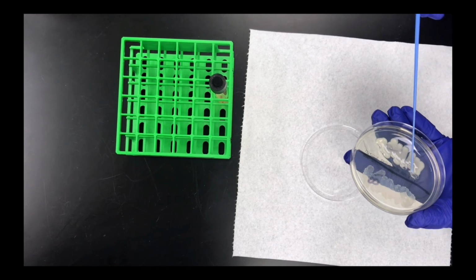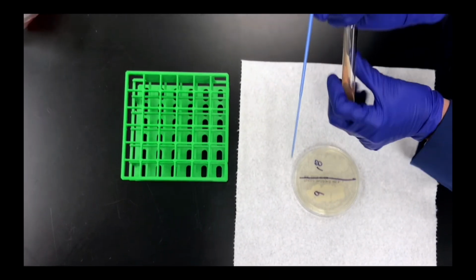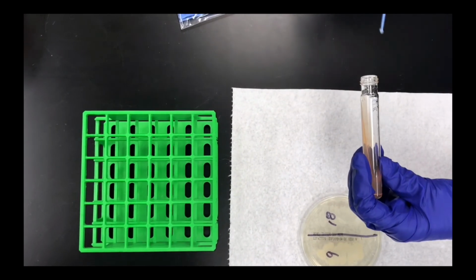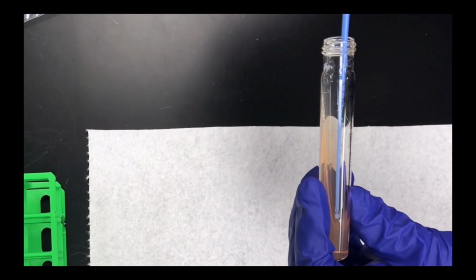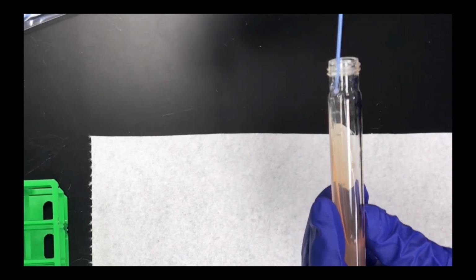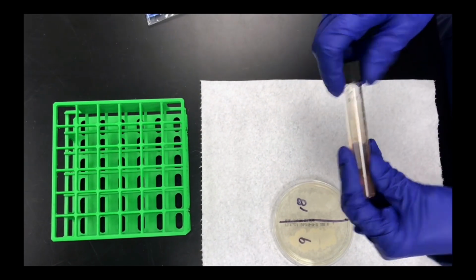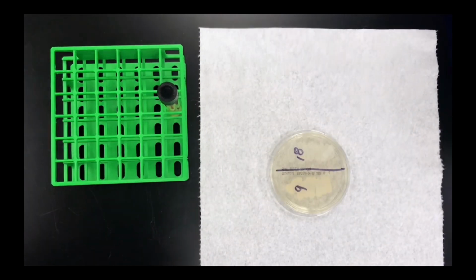So live, this is what that looks like. Take a tiny, tiny bit of inoculant to put on the loop, and we're using this loop immediately after taking it out. Unscrew the test tube, put this inside. Notice how it's going to pierce to the very bottom of the gel. Take it out, and on the surface, do a smooth zigzag fishtail inoculation. Immediately close the test tube, and that's how you would do a stab and fishtail inoculation of an agar slant.